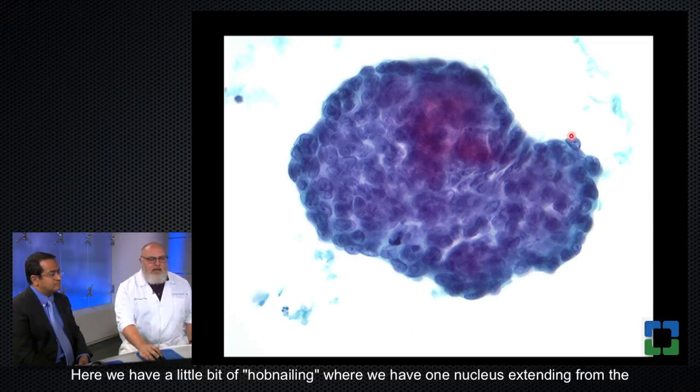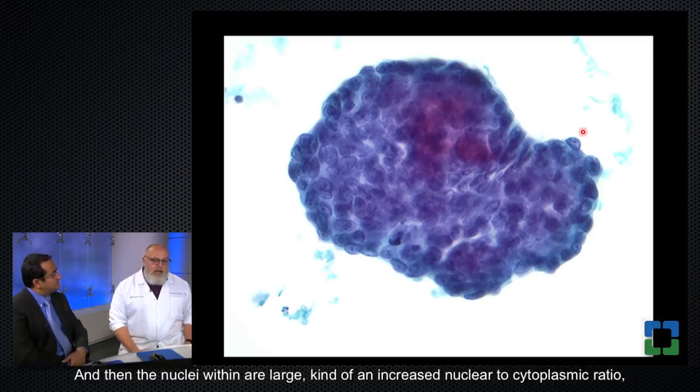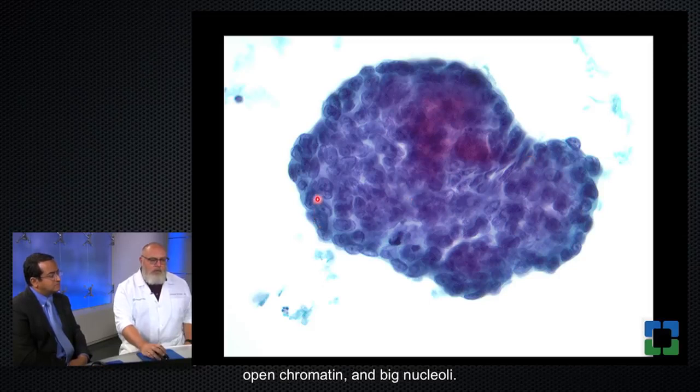Here we have a little bit of hobnailing where we have one nucleus extending from the edge of the group, but I think the majority of this group has more of a common border. And then the nuclei within are large, kind of an increased nuclear to cytoplasmic ratio, open chromatin, and big nucleoli.